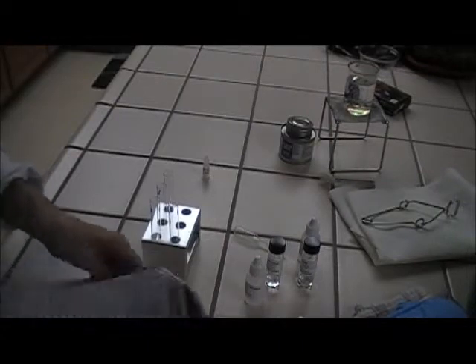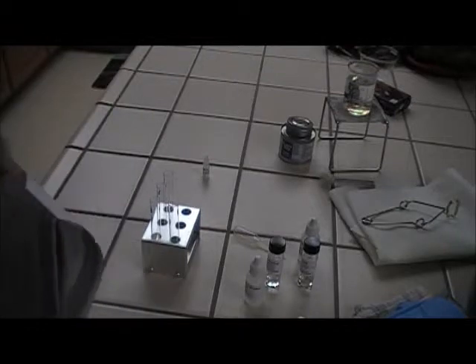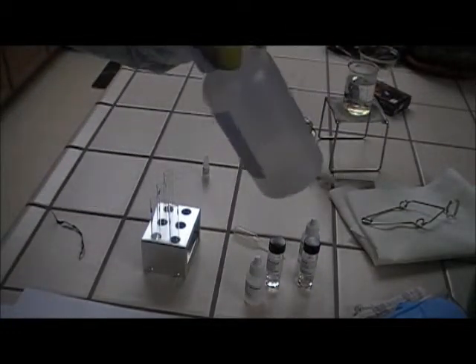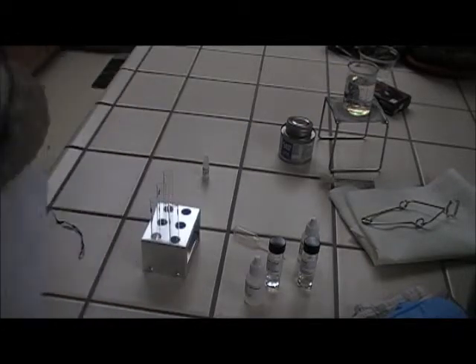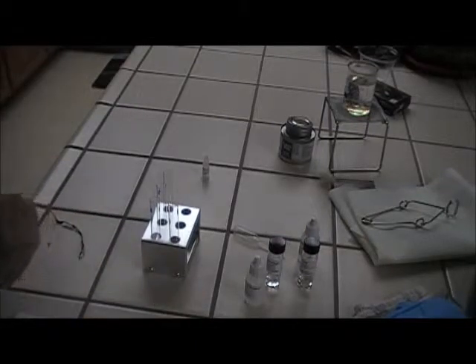As I began this experiment, I noticed for test tubes 1, 2, and 3, which contain acetic acid and methanol, I don't know if you can see this, there is nothing in there. That's my methanol. Here's my acetic acid with absolutely nothing. So I can't quite do part 1 of the experiment, so I will be skipping ahead to part 2. And I will be getting the test tubes ready.